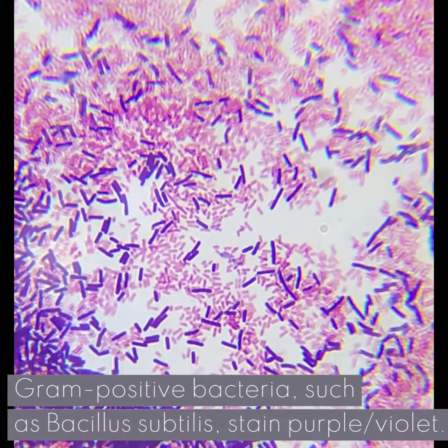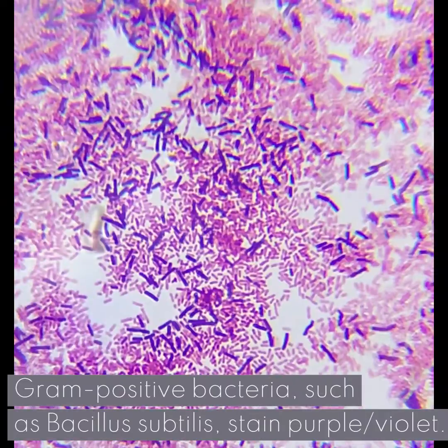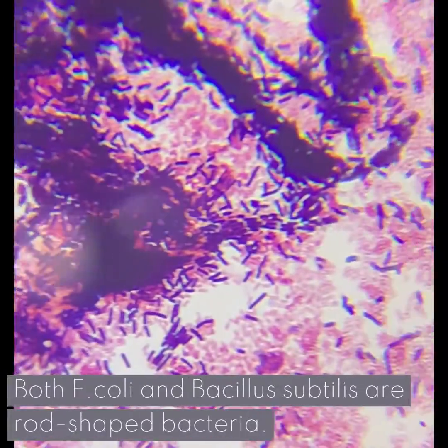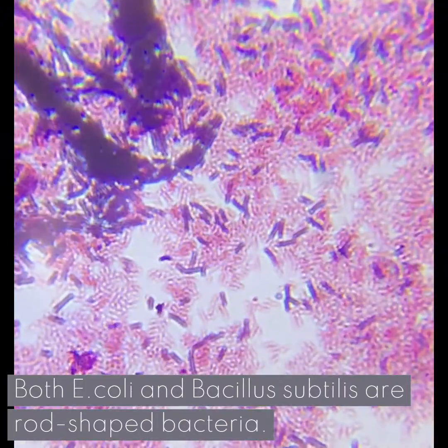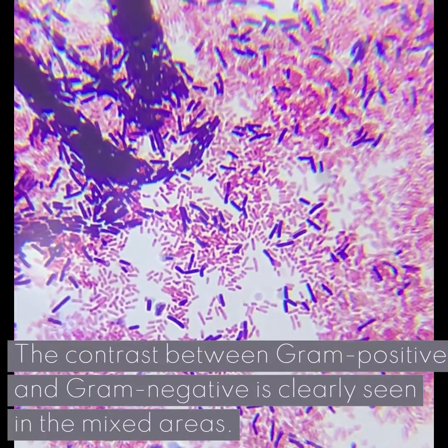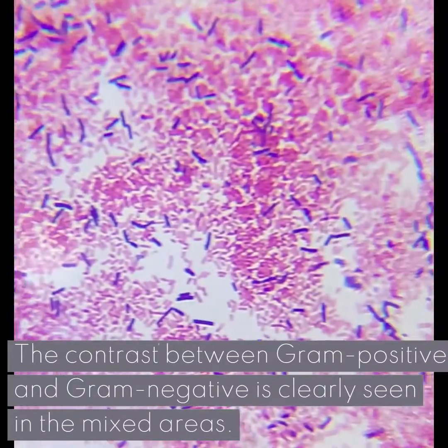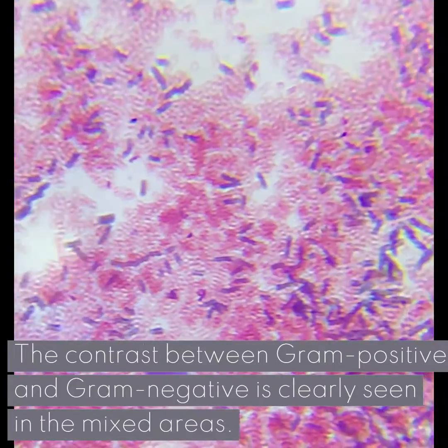Gram-positive bacteria such as Bacillus subtilis stain purple-violet. Both E. coli and Bacillus subtilis are rod-shaped bacteria. The contrast between gram-positive and gram-negative is clearly seen in the mixed areas.